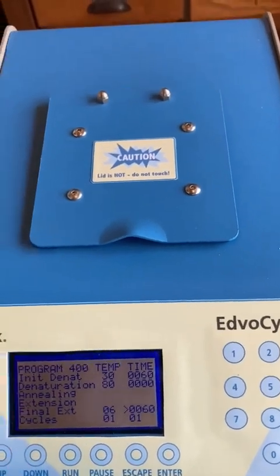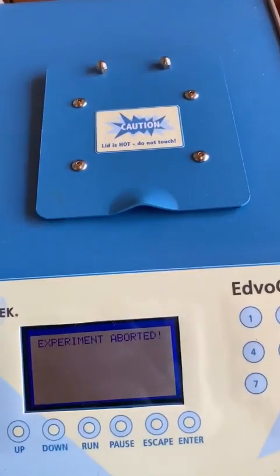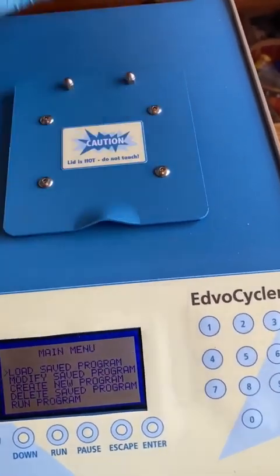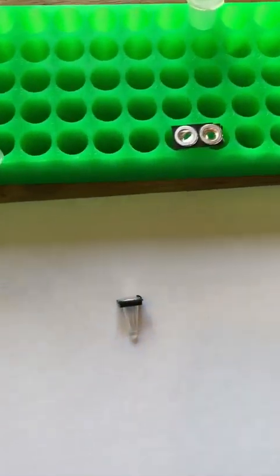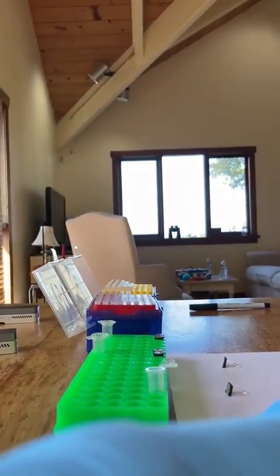These samples are done because they've done 1 minute at 30 degrees and 1 minute at 80 degrees. And now, turning that off and trying not to burn myself. Put those back in front of me. Keep them separated. They don't need to be labeled because I know the one on the left is L, the one on the right is S.